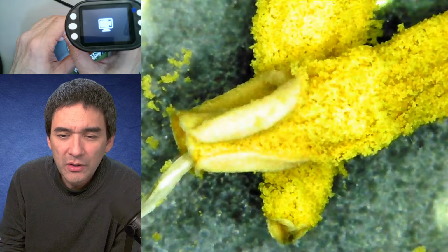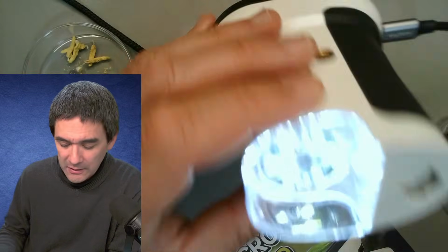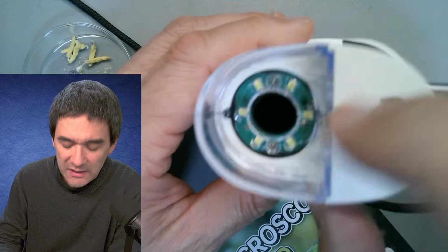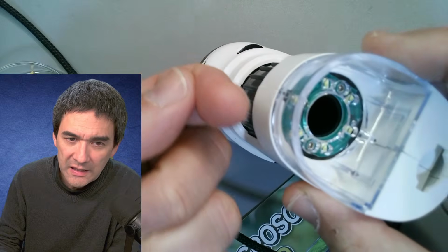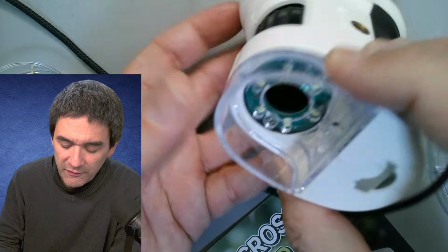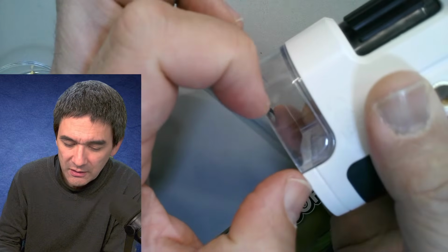I'm just reading a little bit here. What is the working distance? Look, I'm going to show you. It's 3 centimeters, 4 centimeters, 5 centimeters. I'm going to turn this around now. The working distance is the distance between the lens and the object. Deep in there is actually the lens, and by rotating this you're able to move it in and out, and this both focuses and also changes the magnification. So it's pretty far away, but of course the object that you can put in here directly cannot be too large, obviously. It's got to fit in here.